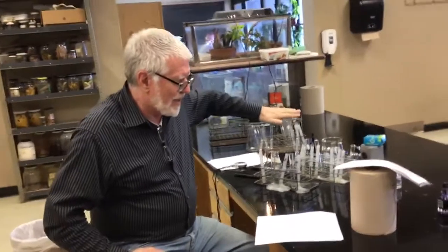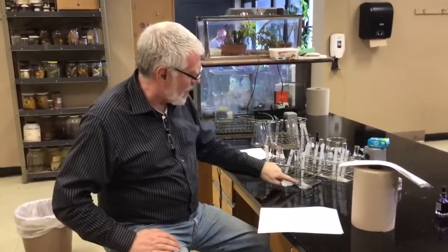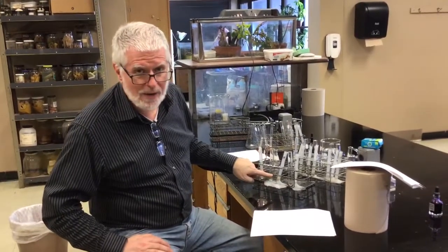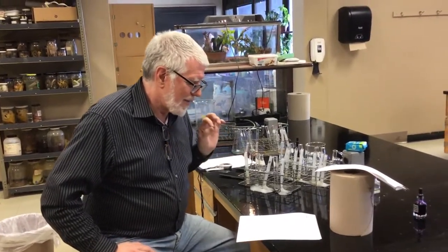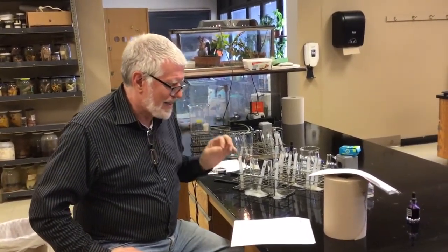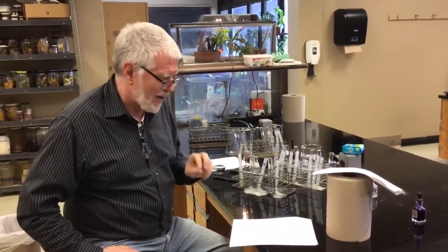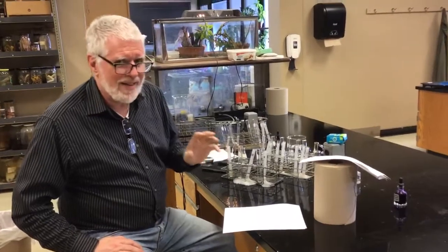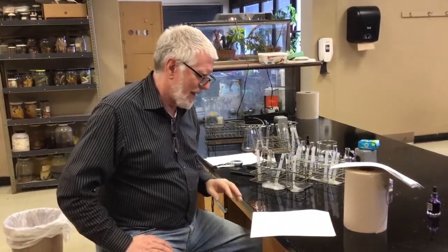In the test that we just ran, every test tube has the same amount of catalase to start. Why is that important? That one should be fairly easy. Now, number 4, catalase has 4 what are called hemes. These are prosthetic groups that contain iron. Give a way that might enhance its activity. If you think about it, you know about something else that has 4 hemes in it.